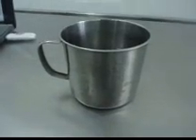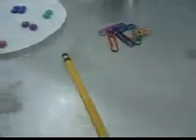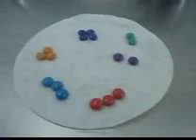The materials needed are: beakers, paint brushes, filter paper strips, water, paper clips, a pencil, and candy sweets of different colors.